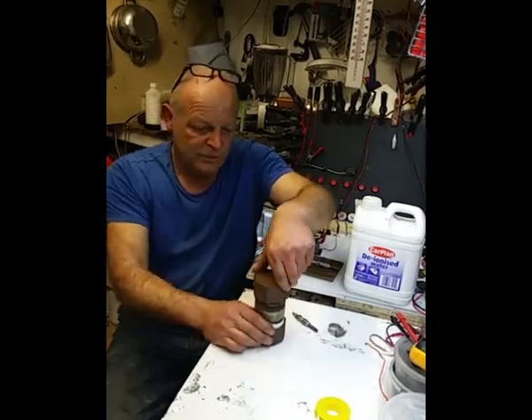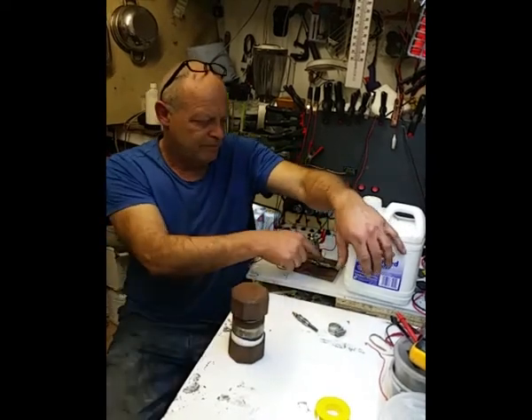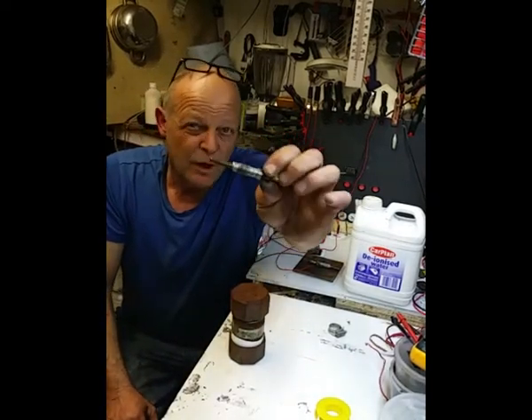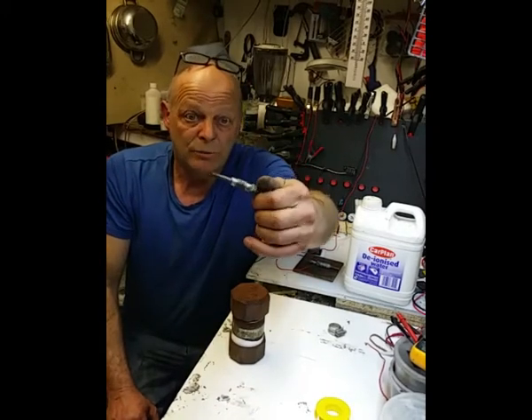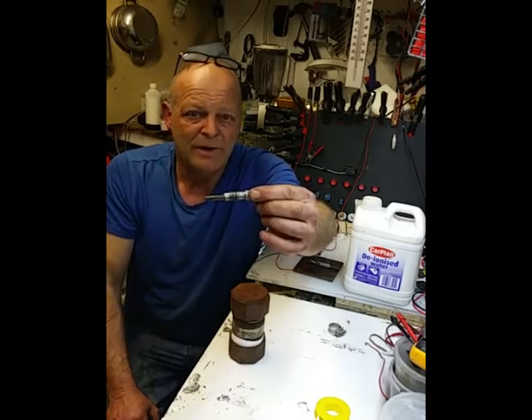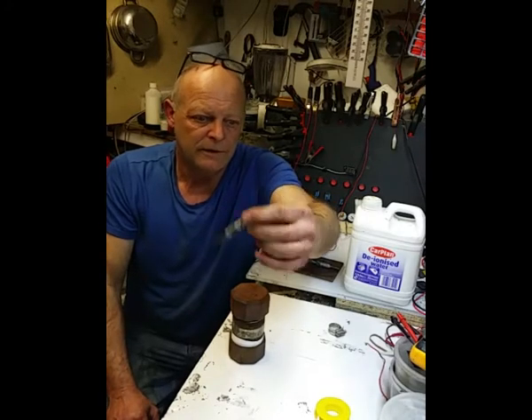Now what I said I was going to do was use one of these. Now that is from a diesel engine, and it's a glow plug, and any glow plug will do from any diesel engine. I think I bought these on eBay. I paid about £18 for 4. I think these were Land Rover ones or something like that.